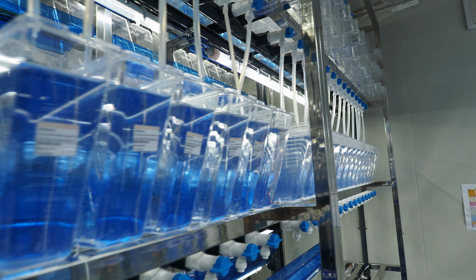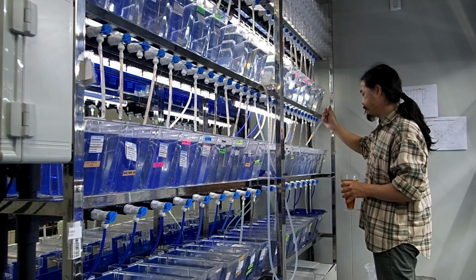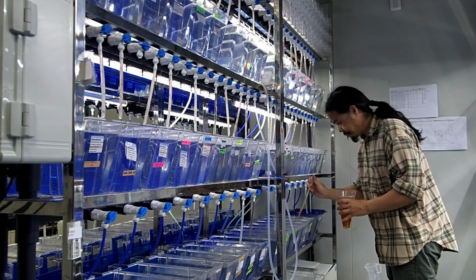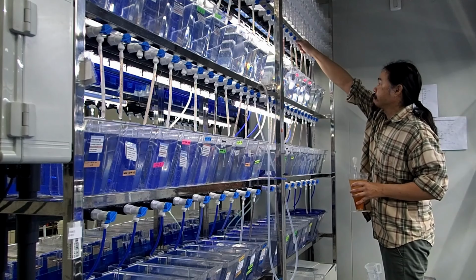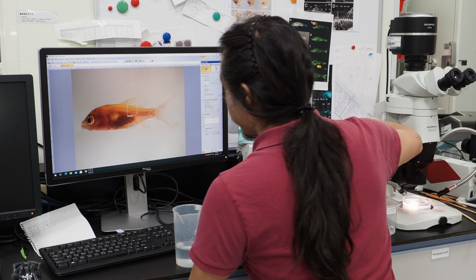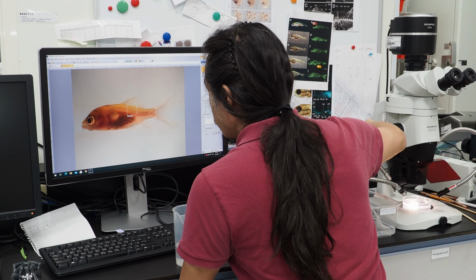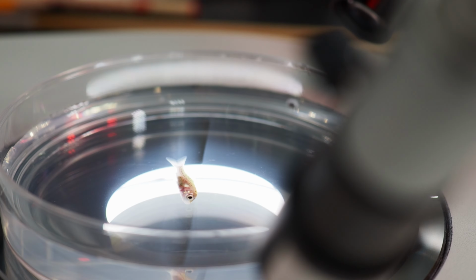In our laboratory, we have a system of clustered aquariums where 1.5-liter tanks can be arranged side by side, allowing us to keep over 50 goldfish larvae at a time. We regularly observe and photograph them. To keep the fish still during the photography, they are lightly anesthetized.